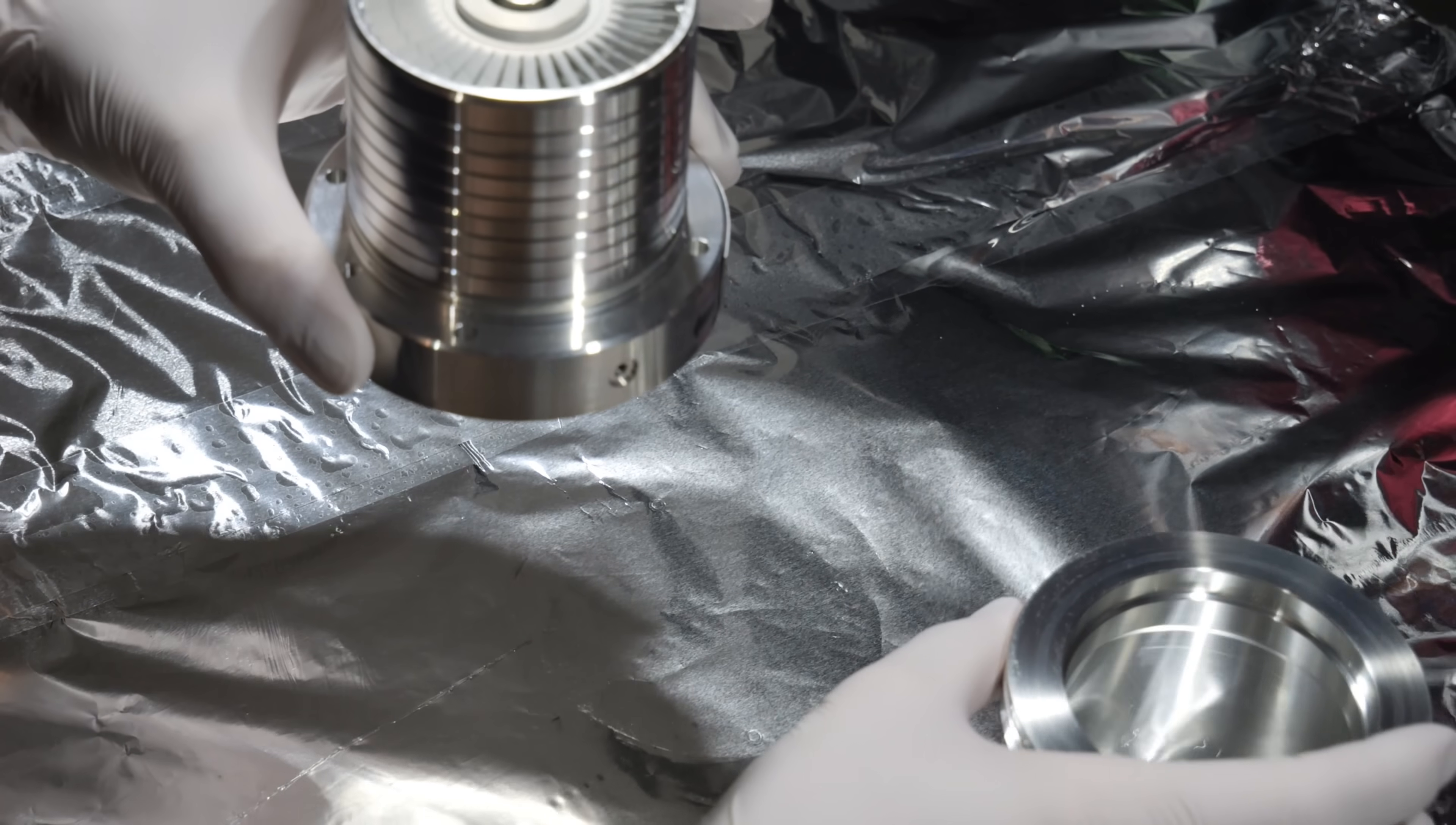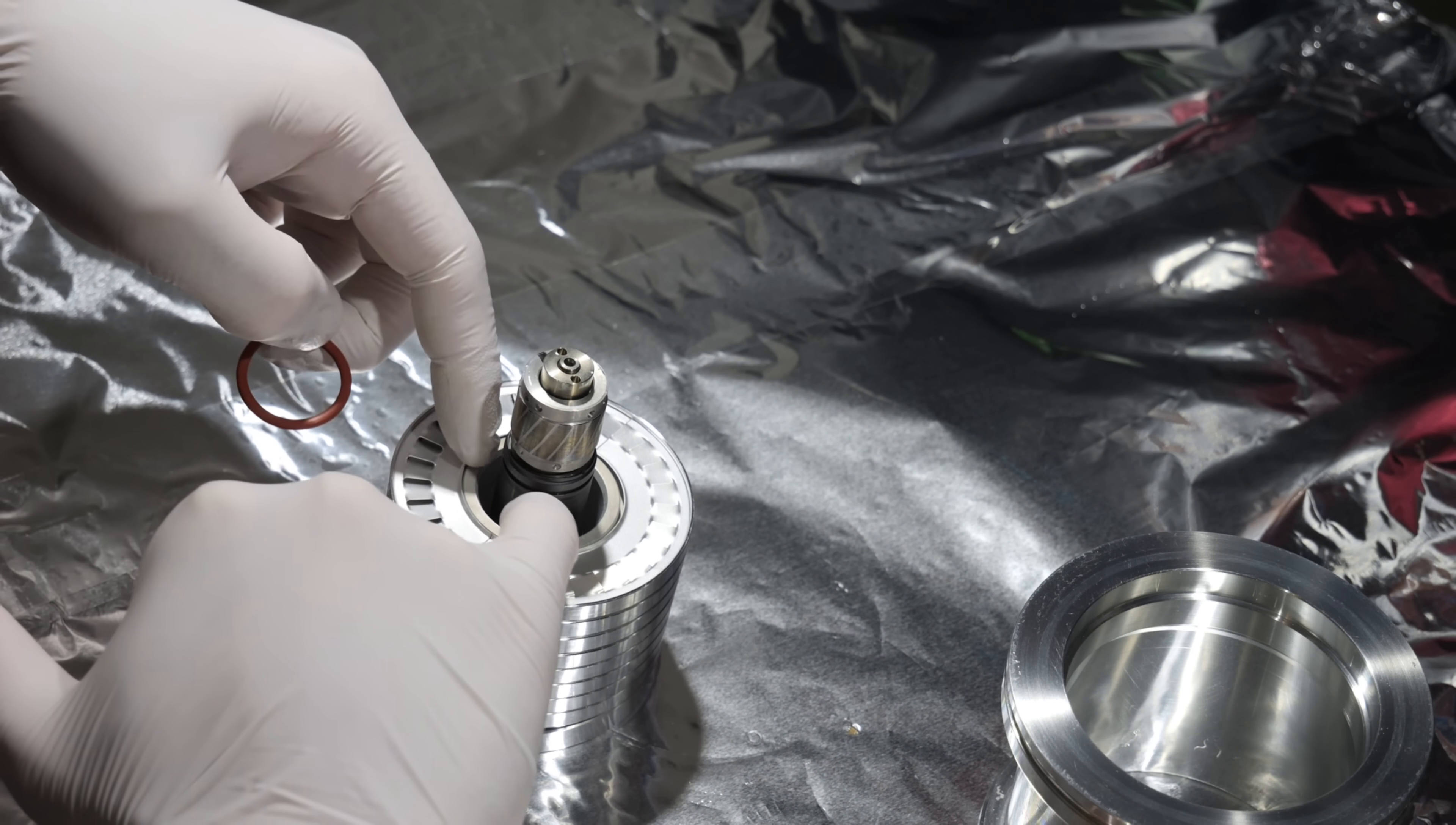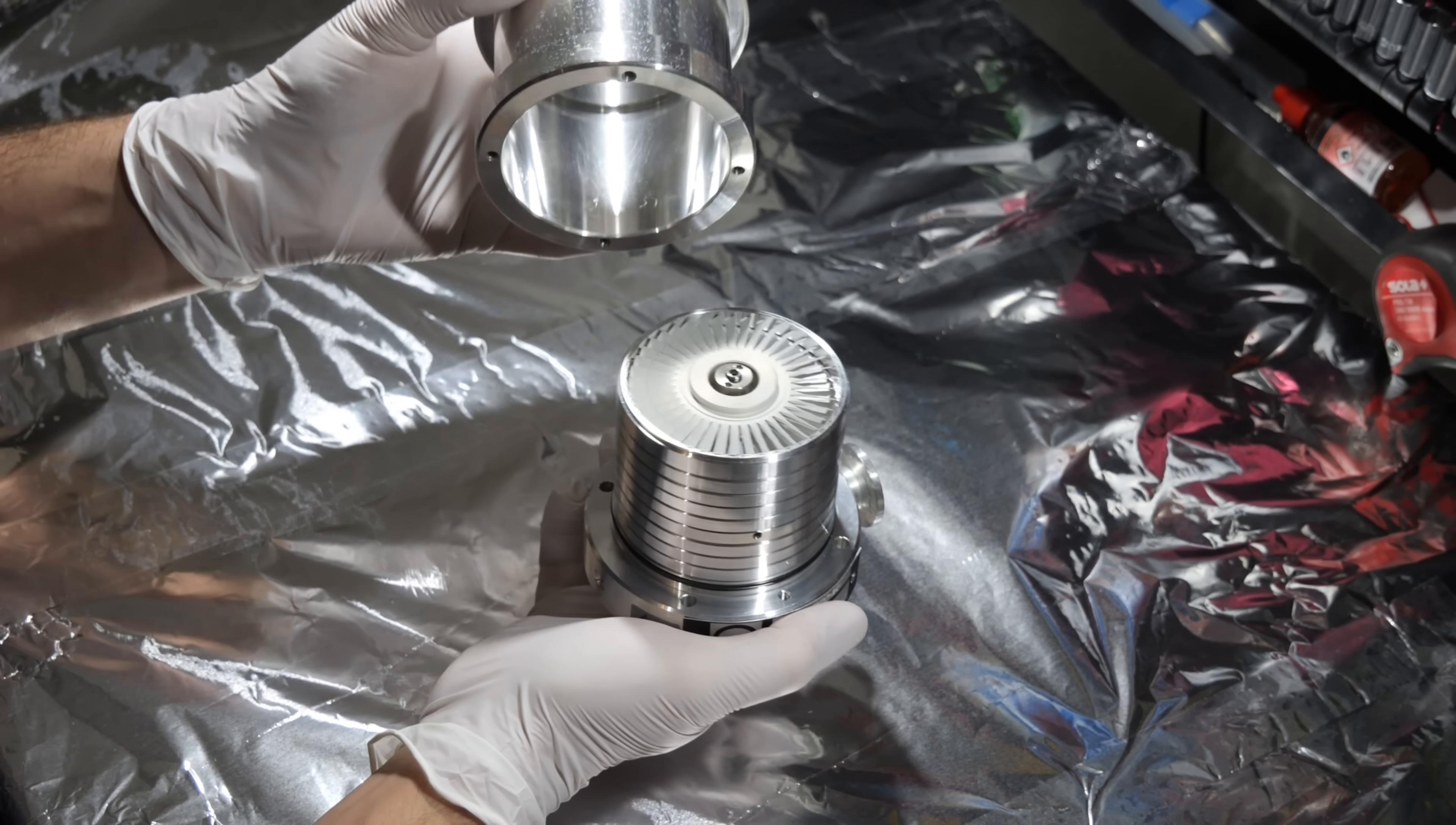Okay, I forgot something. That's great. I thought I could do it after the fact but I can't. There is an o-ring which goes inside this part here around the shaft so that's what I'm going to install. I think the easiest method to get this o-ring in is to put it right here which is the surface that seals inside the rotor. Okay, I think we can now put it in the housing.